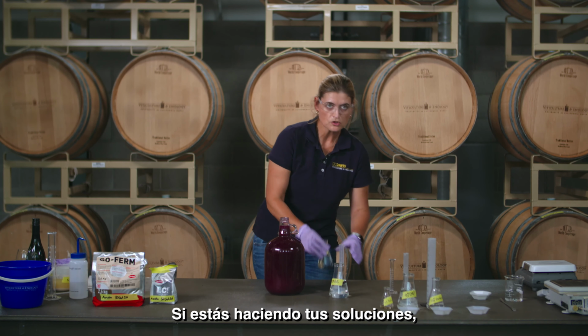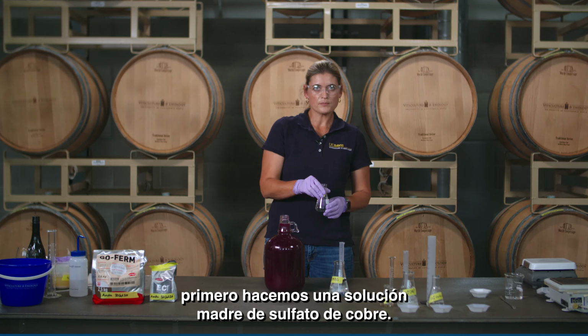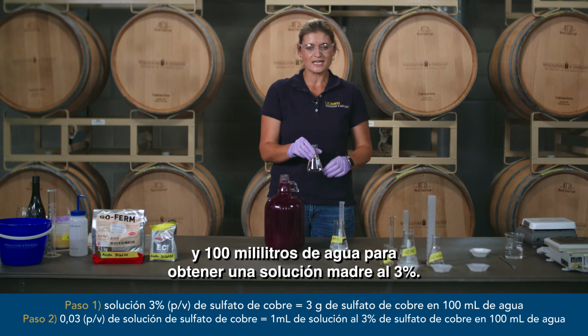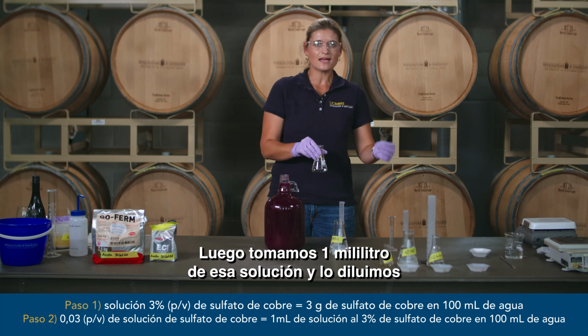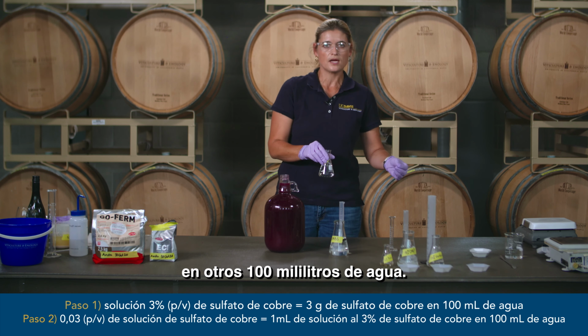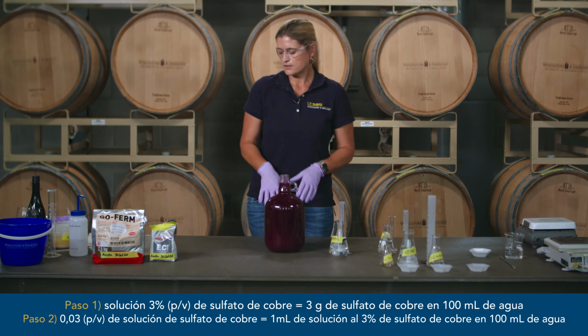If you're making up your solutions, we first make up a stock solution of copper sulfate using 3 grams of copper sulfate in 100 milliliters of water to get a 3% stock solution. Then you take 1 milliliter of that solution and dilute it into another 100 milliliters of water. And then you get a 0.03% solution. And that is your working solution that you're using for your additions.